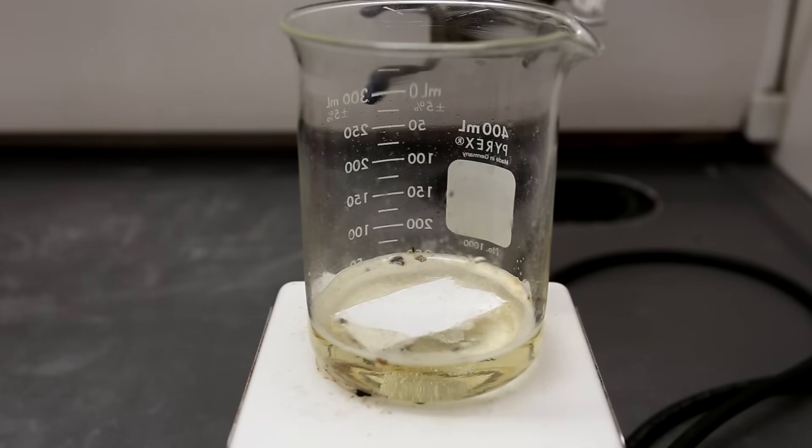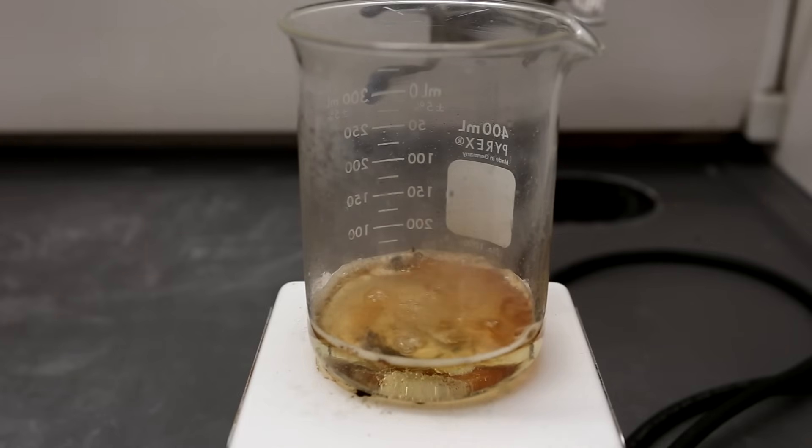The organic material reacts extremely readily with the solution and you should definitely not try this with any organic solvent. Liquid organics can and have resulted in explosions.